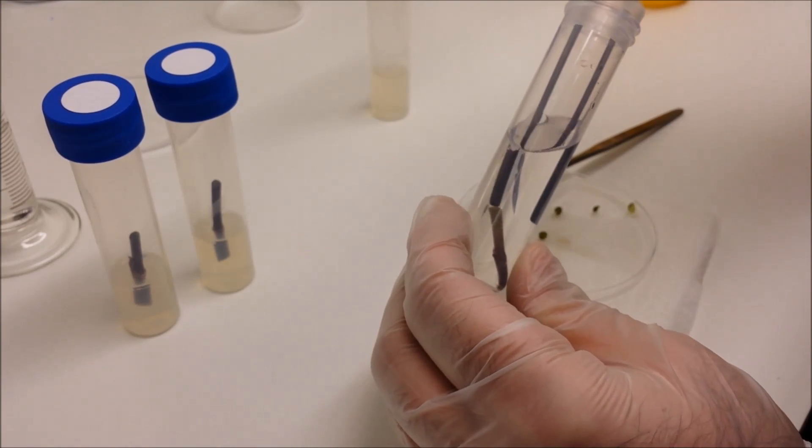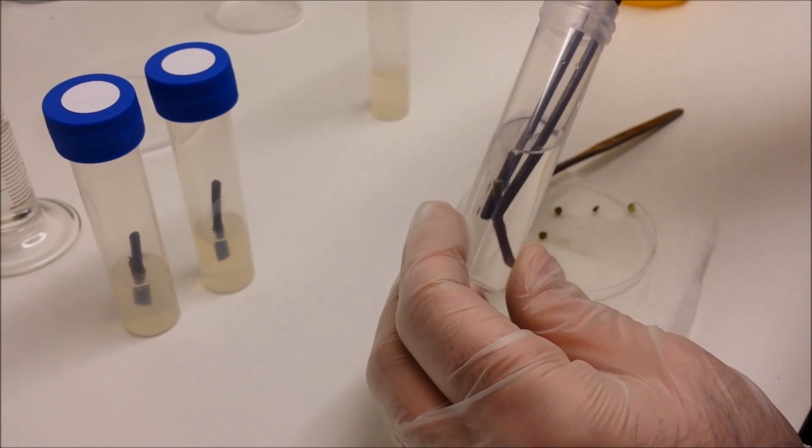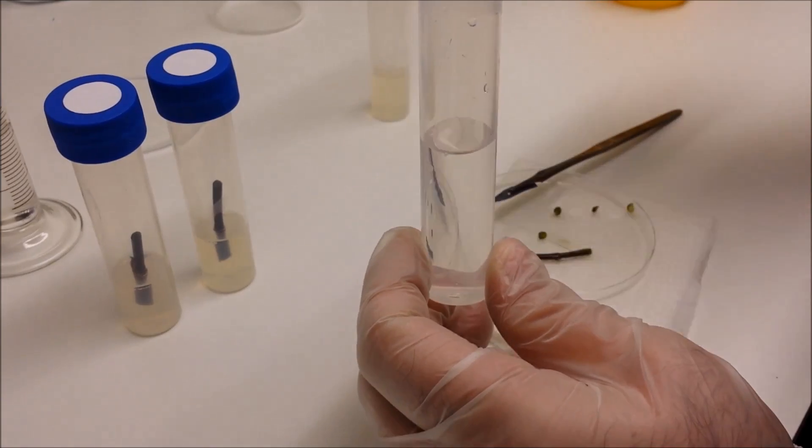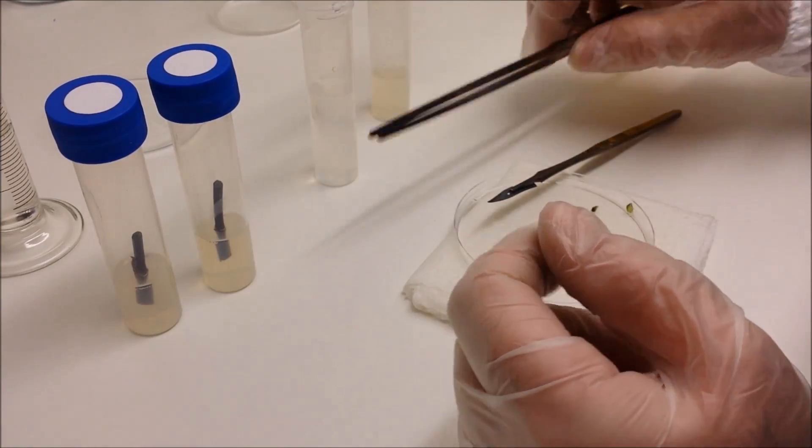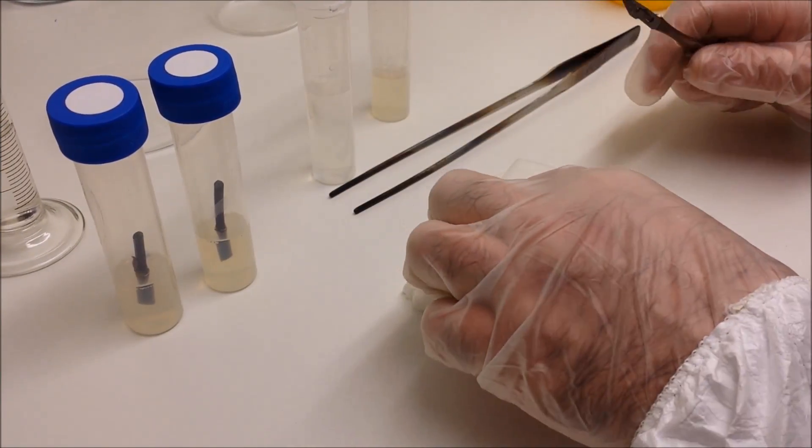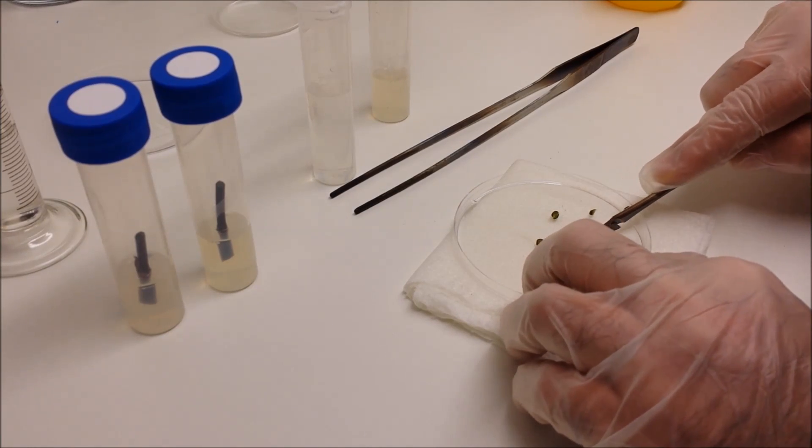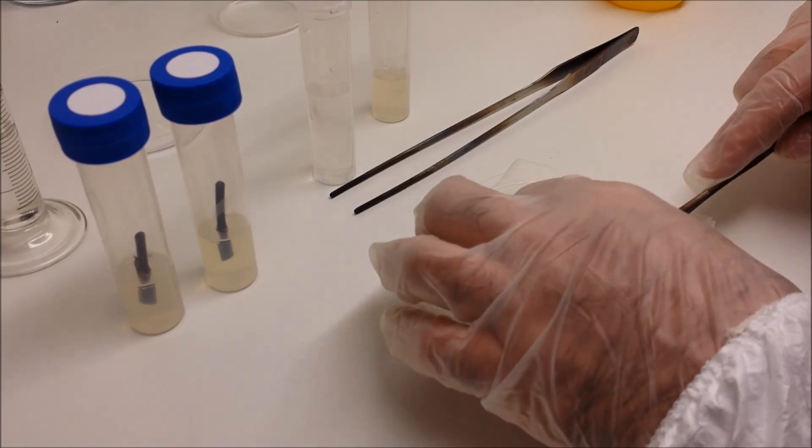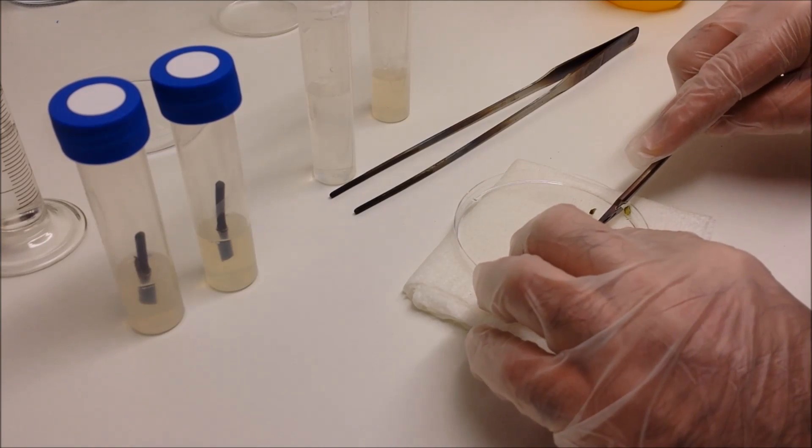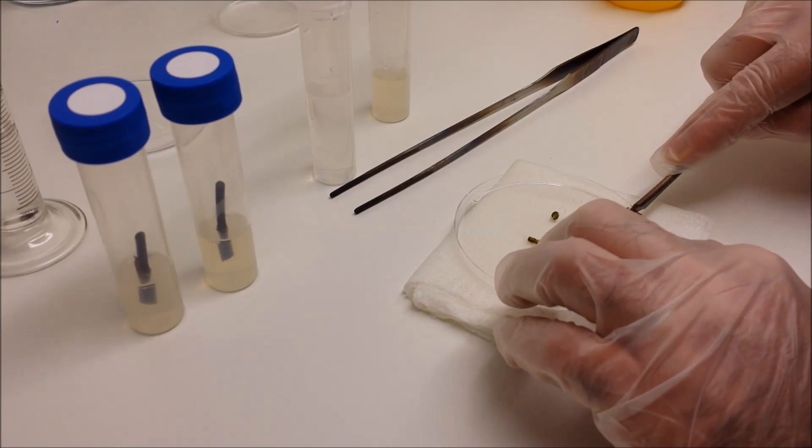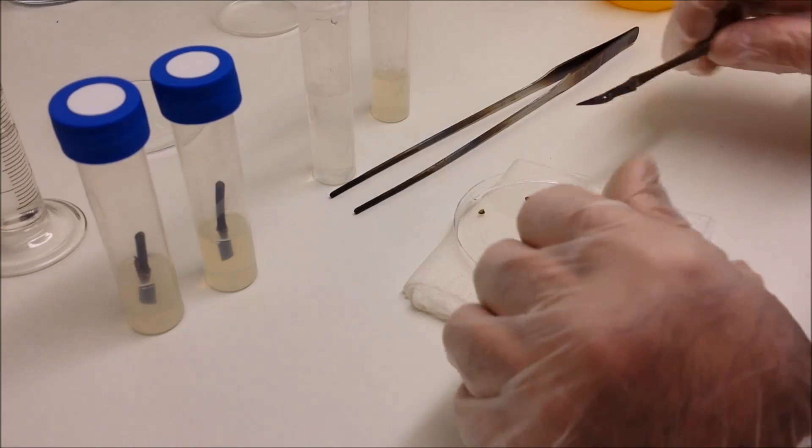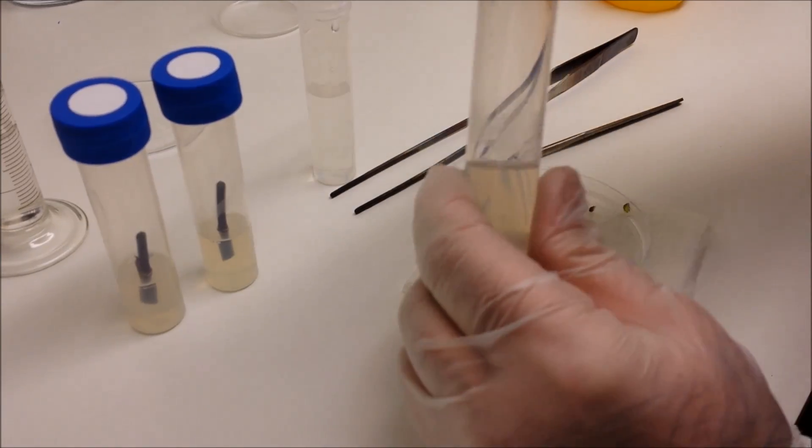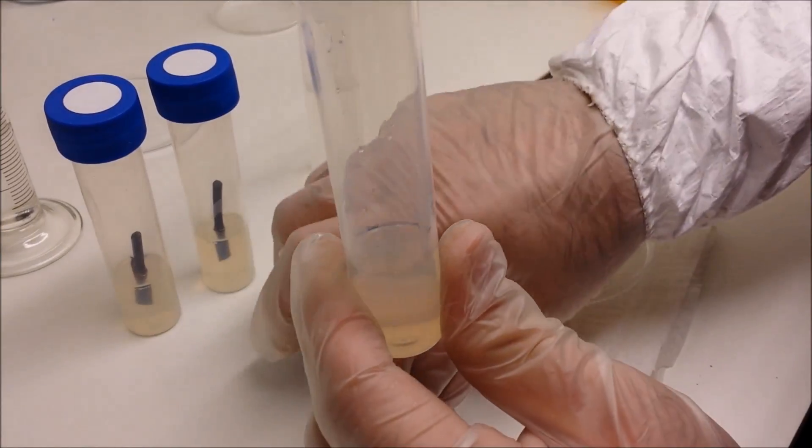And the final one. Take off the tips. And of course we know which way up they are because if you remember, we cut them so that the bottom end was pointed and the top was flat, so you know that you're not planting your cutting upside down.